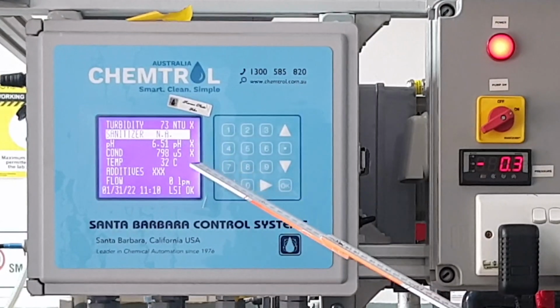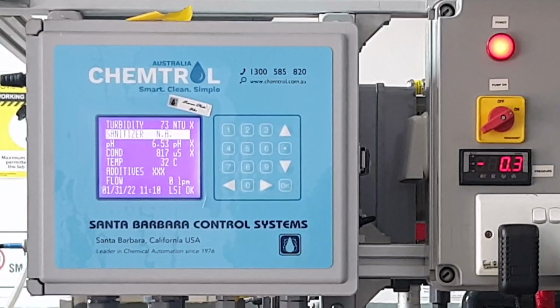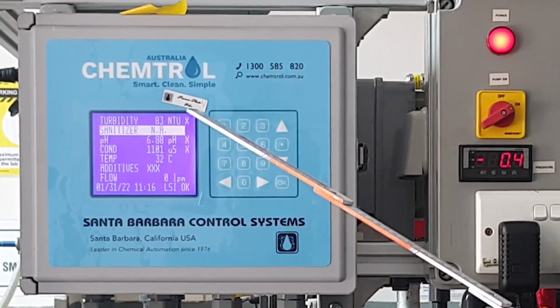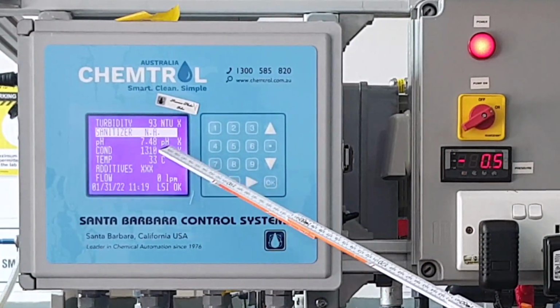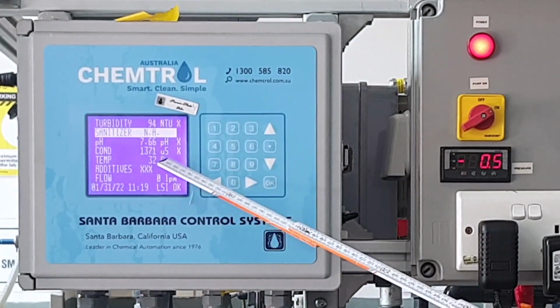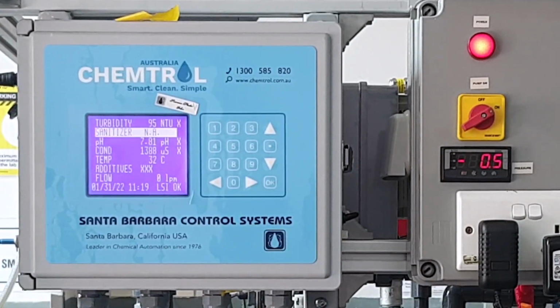So you can see the pH is rising, turbidity is still 73, conductivity is also rising to 800. The pH has now risen to 6.88, still some turbidity in the system, and conductivity continues to rise. Adding another batch of magnesium hydroxide raises the pH up to 7.5. Again, we still have a rise in conductivity. Turbidity is increased slightly to 94 because the magnesium hydroxide is not particularly soluble, but does react in the end.